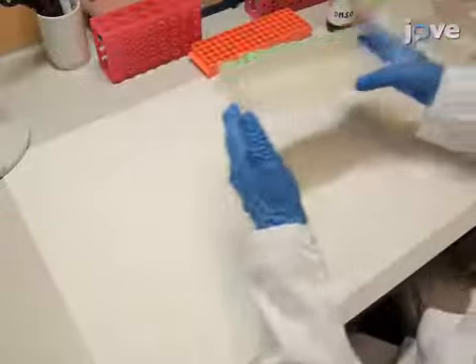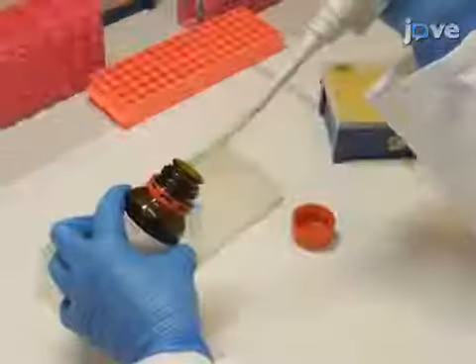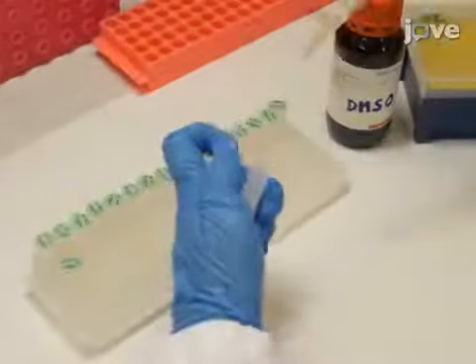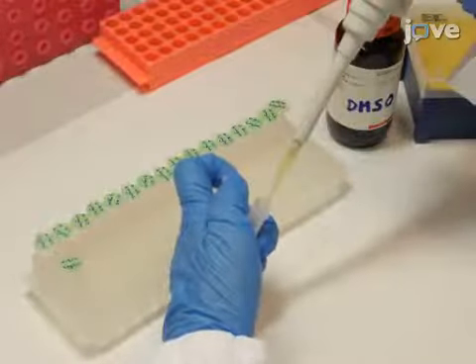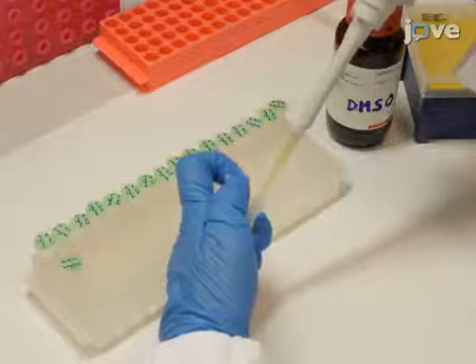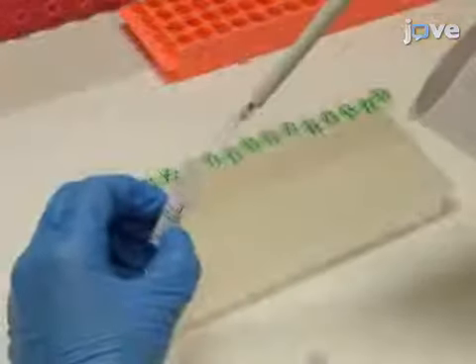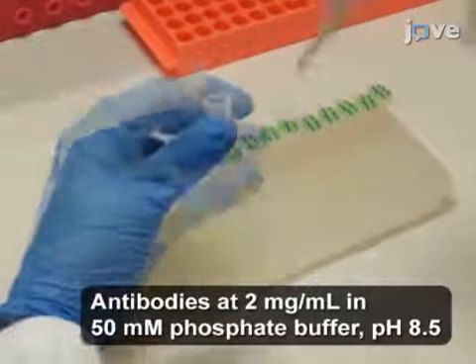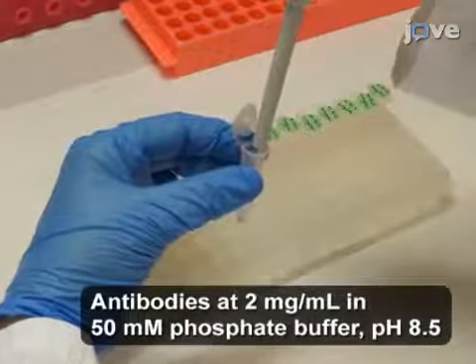After producing and purifying antibodies according to the text protocol, add 100 microliters of DMSO into a commercial vial containing dye for labeling 1 milligram of protein. Once the dye is dissolved, label the purified antibodies by adding 2 microliters of the dye to 50 microliters of each antibody preparation.